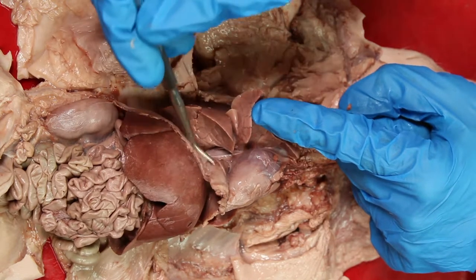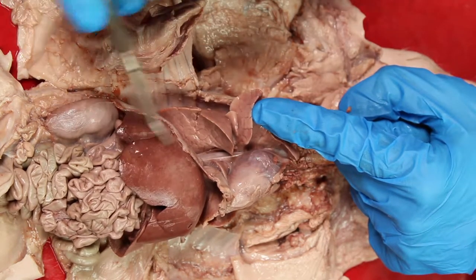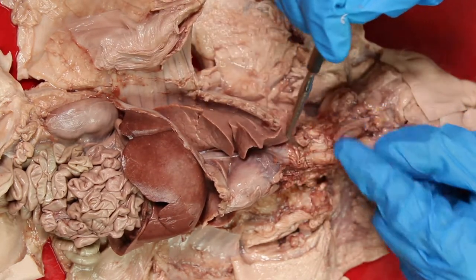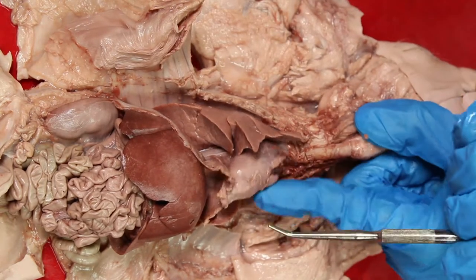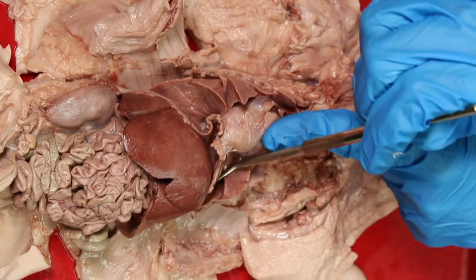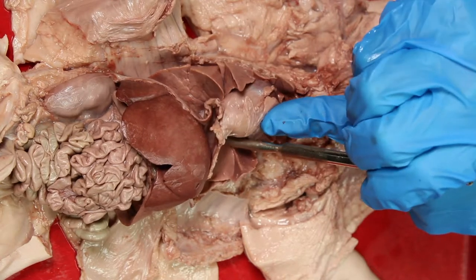a central recession at the root of the lung. The primary bronchi branch into lobar bronchi, which in turn branch into tertiary or segmental bronchi. Each bronchopulmonary segment has its own segmental bronchi and arterial supply, making each segment a discrete unit.